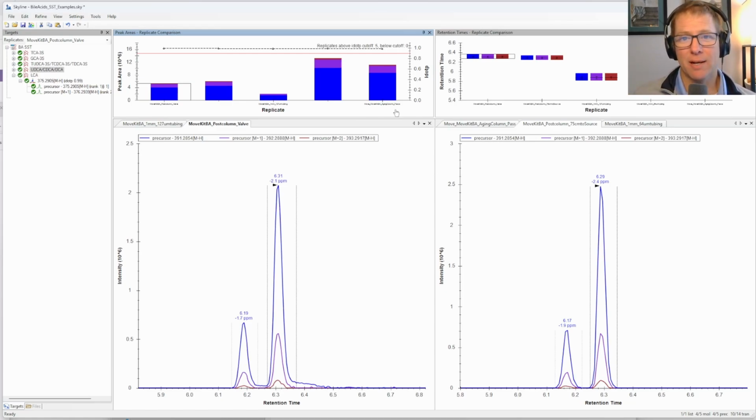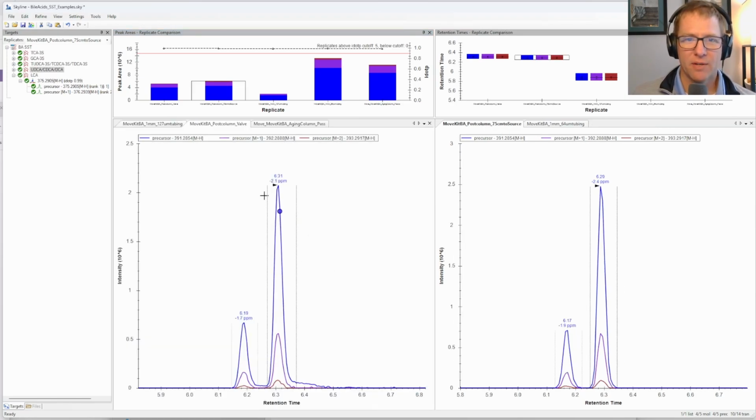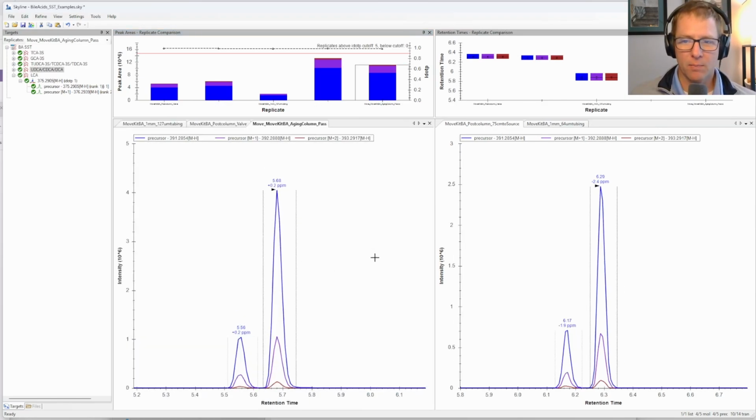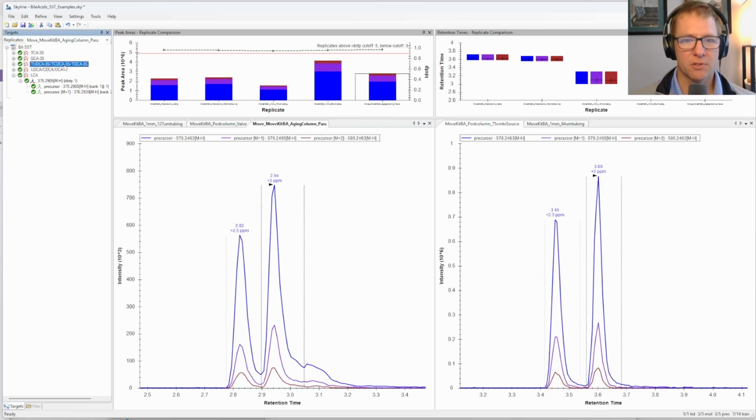Okay, last little thing I want to show is a third separation, which is a scenario where we have a nearly equivalent post-column separation, but yet if we look at a different set of metabolites early on, the peak shape looks quite less good. Okay, so these are sulfated metabolites.